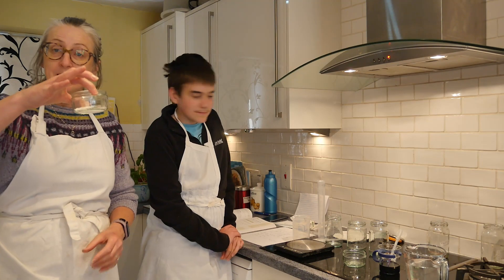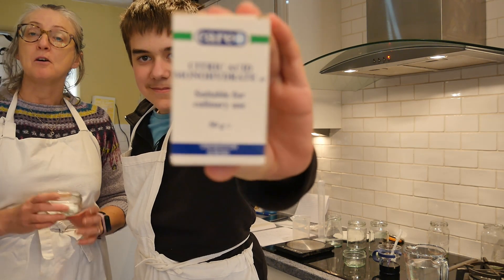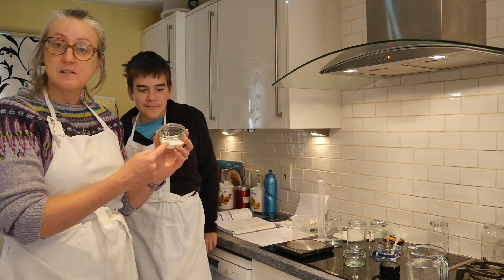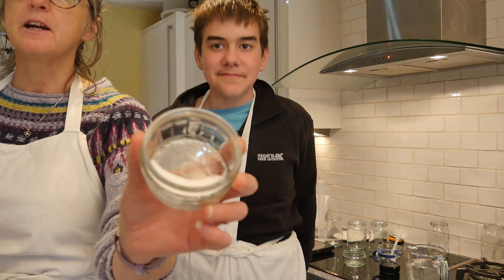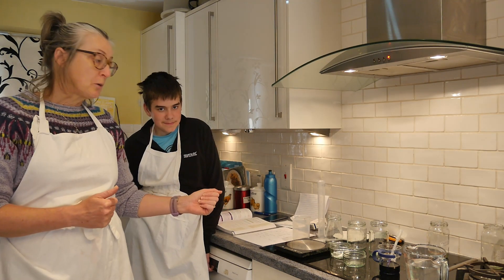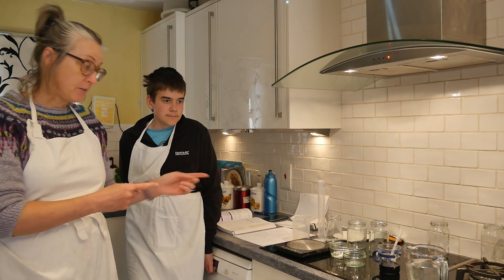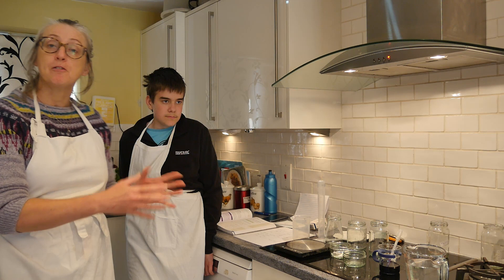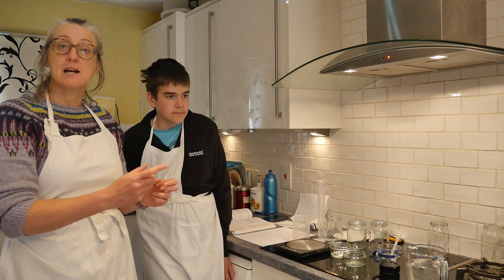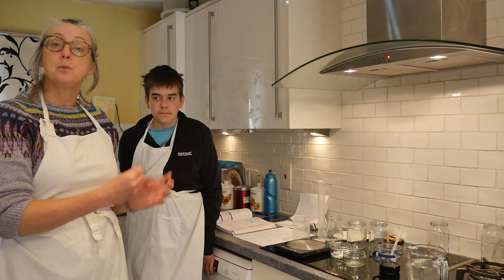We're using an acid solid that you can easily get hold of today. This is the box — you can get hold of this very easily from shops that do baking. We got ours from a chemist. This is what your citric acid looks like when you've got it out; this is actually only about 10 grams of it.